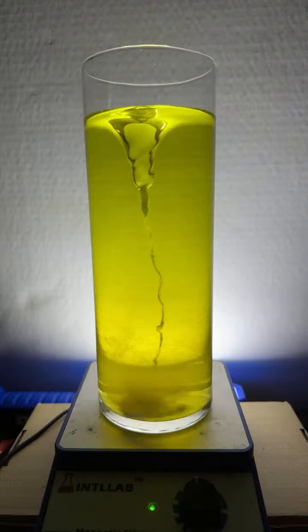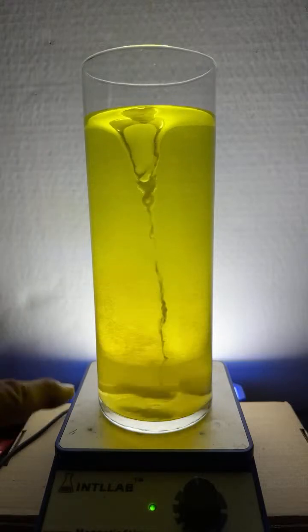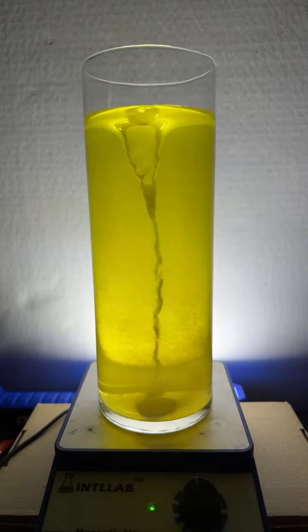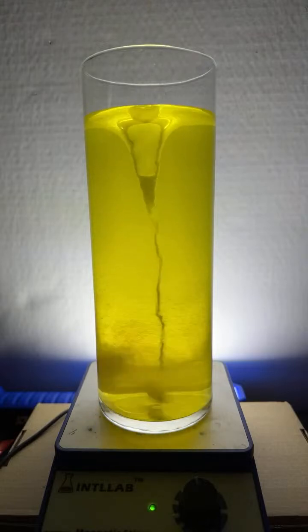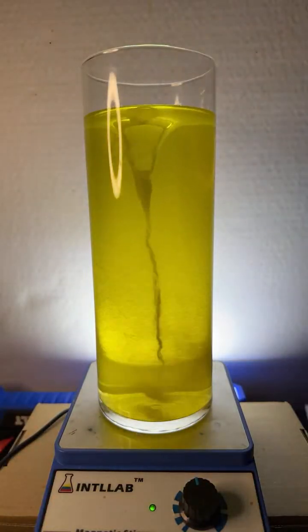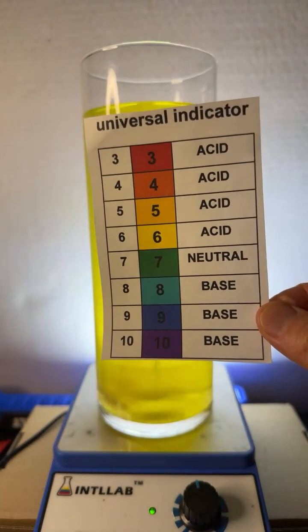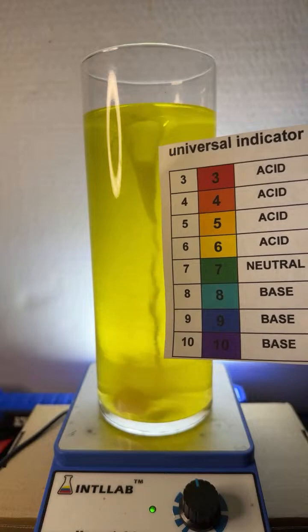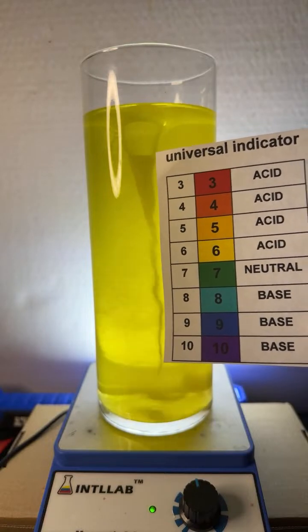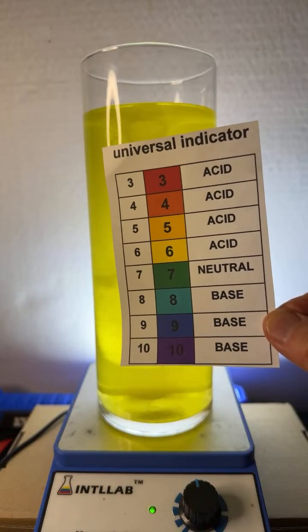It's a good question. So, Riker, what I use to color this particular one is a mixture of chemicals known as universal indicator. So this one has the rainbow indicator in it, which displays these colors at different pH values. So you can see this one is slightly acidic. It's like a greenish yellow color. A little bit more yellow than green, so I'd call this like a pH 6.3, 6.4, somewhere in there.